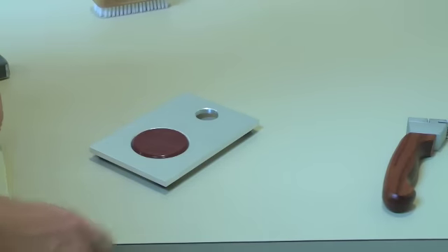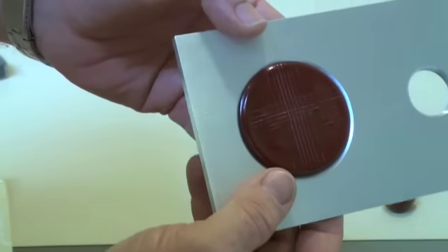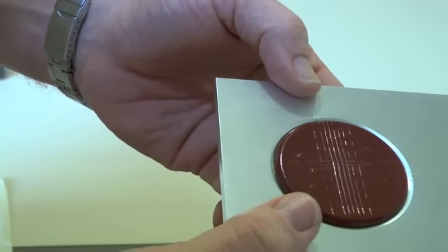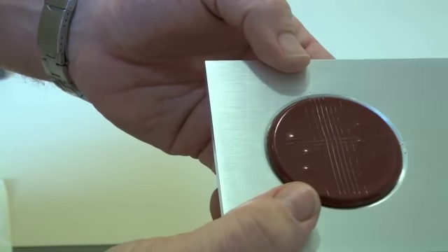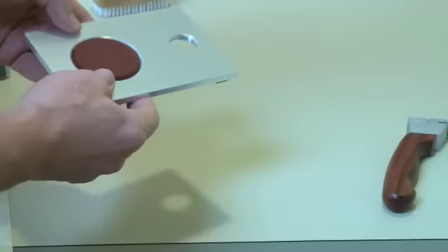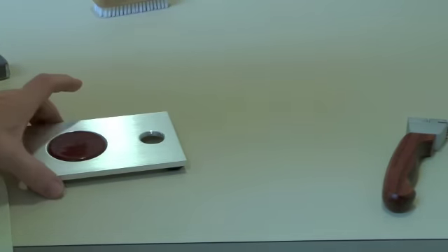And as you can see from that picture, our crosscut test doesn't show any lifting of coating in the corners. So we are getting a very good adhesion of our coating on this particular test piece.